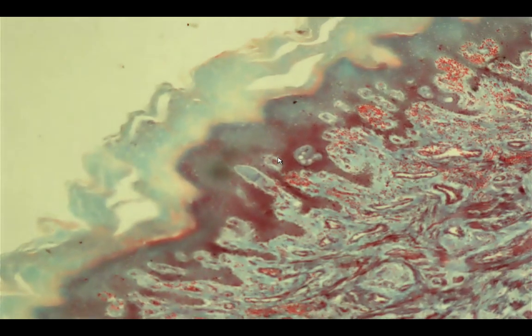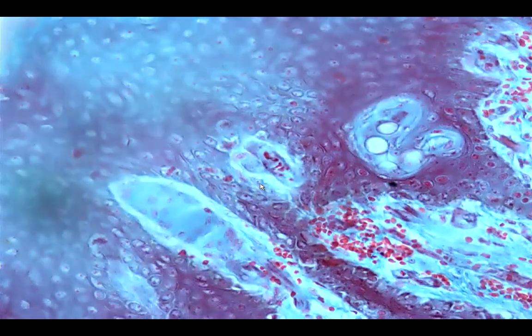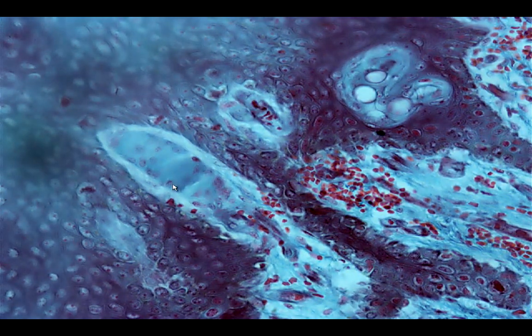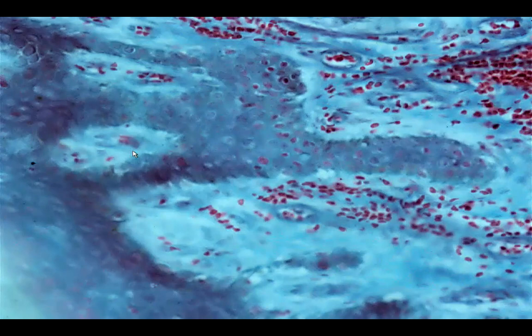Okay? So what are we going to look for? Okay? So we are going to look for something like this one. Okay, so it's like a bullet there. So we are going to look for these aggregates of flattened Schwann cells, and this is a sensory receptor for touch. Okay, so I think that's the only one that I saw.